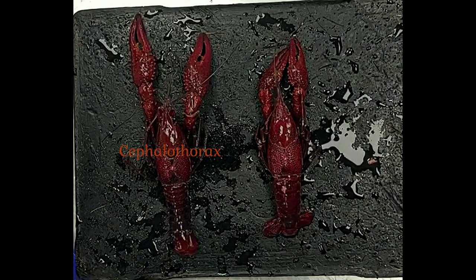We can also see some major body regions here: the cephalothorax, which is anterior to the abdomen. One of the major features of the cephalothorax is the carapace, which is actually the exoskeleton of the head extended posteriorly to cover up the thorax, including the delicate structures of the feathery gills.